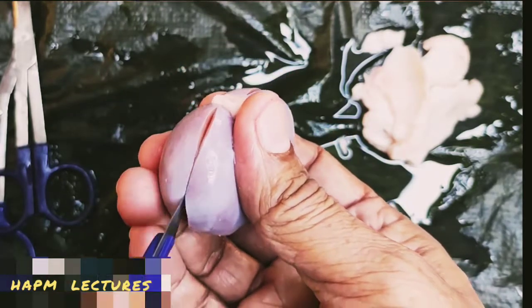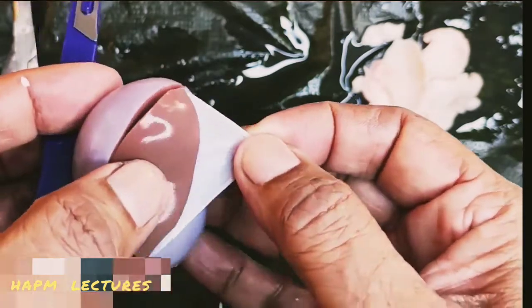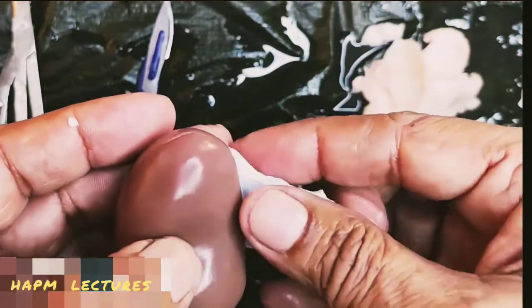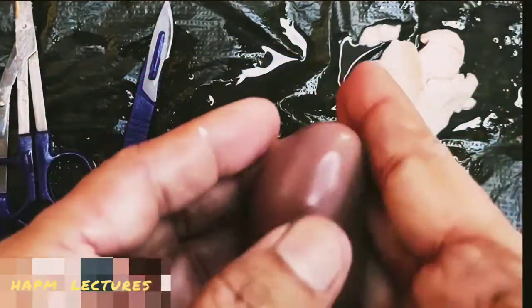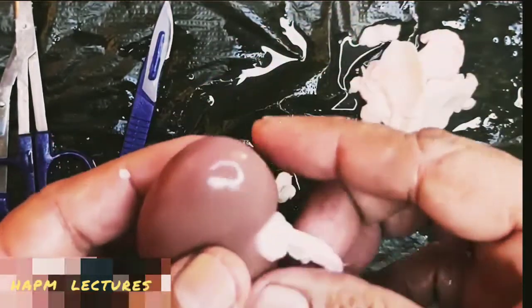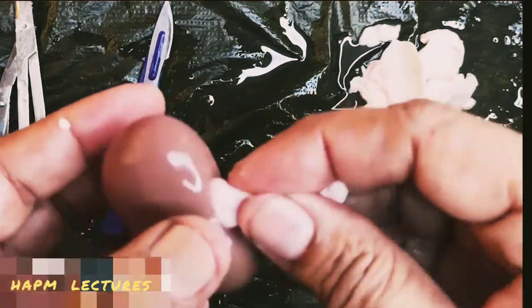Cut it properly. Yes, now what is the thin layer we observe? That is the innermost renal capsule, which we will remove. This capsule, which I just said continues with the ureter, gives protection to the kidney. Here you can observe the reddish brown kidney. This continues with the ureter. Whatever urine, the nitrogenous waste, comes out through this pelvis.